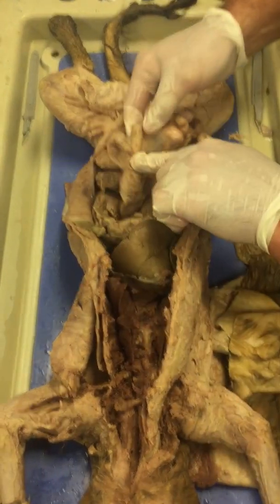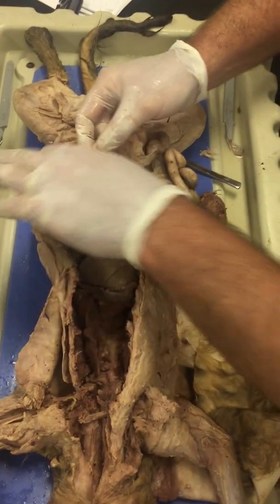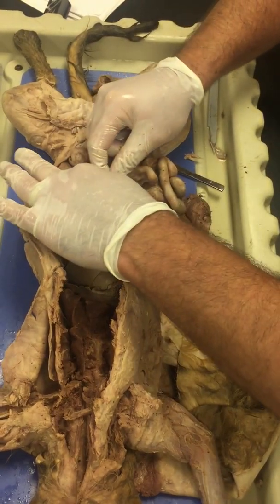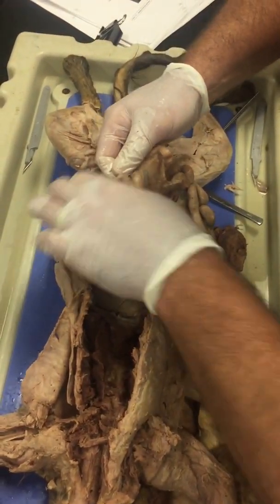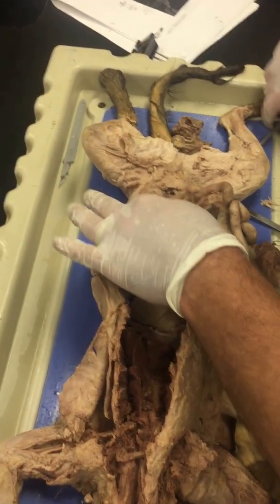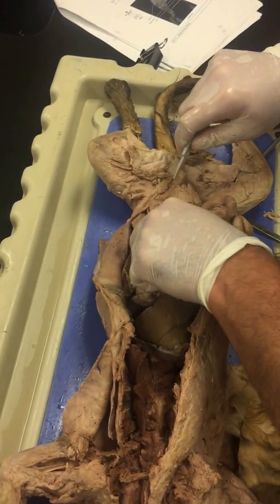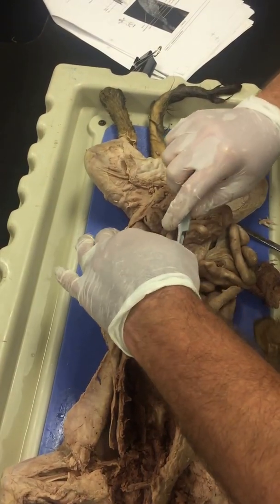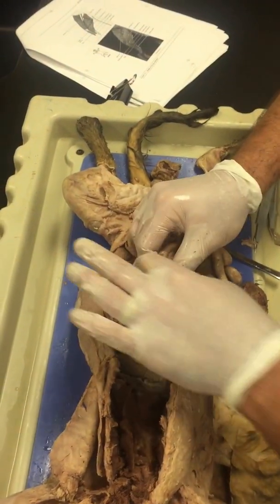Okay, so you can see where the ileum ends and the large intestine begins, because this bump right here is called the cecum. Now in a human that hadn't had it removed, the appendix would be located here. Actually, maybe this kind of looks like it, doesn't it? Maybe not. So this is the cecum.